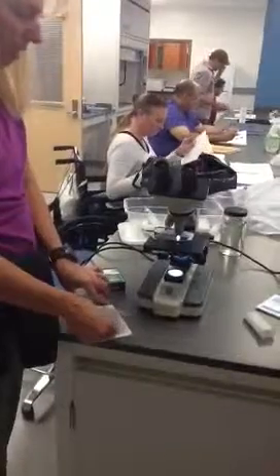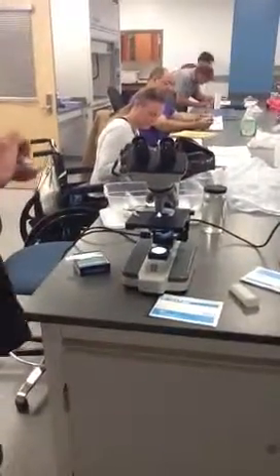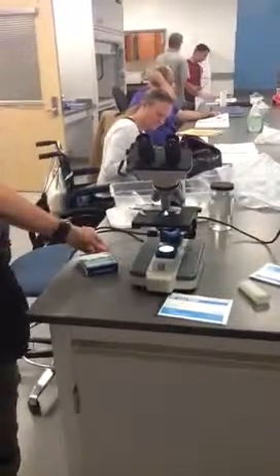When you're done, use lens paper to clean the oil off — this is one of the things that will wreck the microscope. If you're looking through a microscope that's foggy, it's probably that somebody put oil on the wrong lens or didn't wipe it off. You want to wipe off the oil between each slide you look at, because the longer it sits the more it seeps into the lens and I can't remove it. Once that happens it's permanently foggy, and microscopes are very expensive — they won't get replaced just because somebody left oil on it. Wipe the oil off the slide, put the pipette in the garbage — that's how you use the microscope.